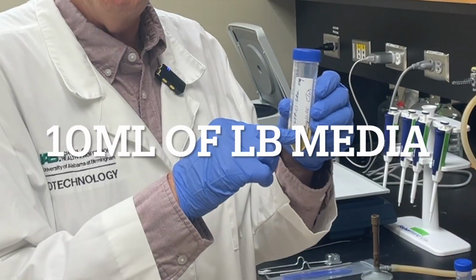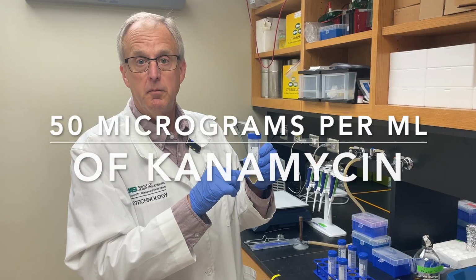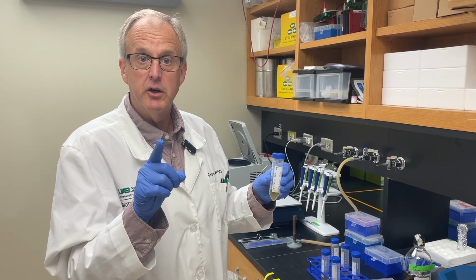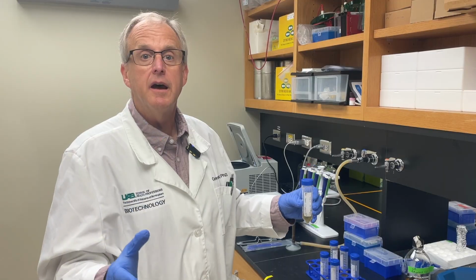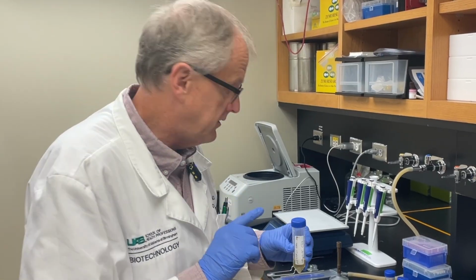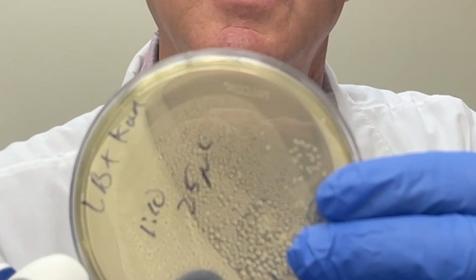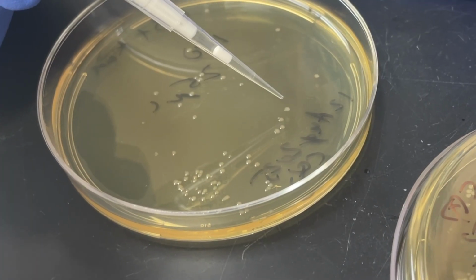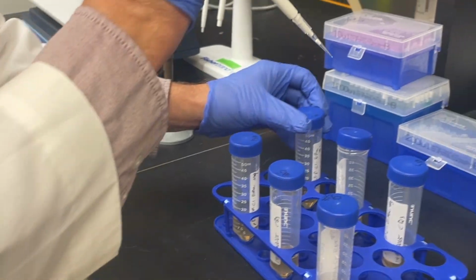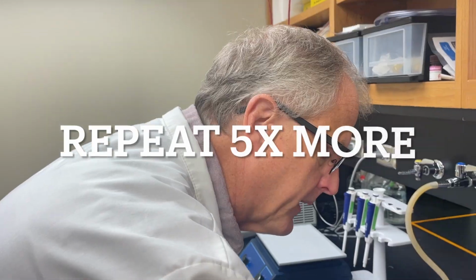Igor set up 10 mils of LB media, and it has 50 micrograms per mil of kanamycin. Remember, we're selecting for bacteria that have been transformed, have taken up the plasmid. And we're using kanamycin as our selection. We're going to pick 6 colonies. As you can see, the colonies are quite separate. All we have to do is find one. All you're doing is touching it. Boop. Open this thing up. Drop. That's it. Let's pick another one.